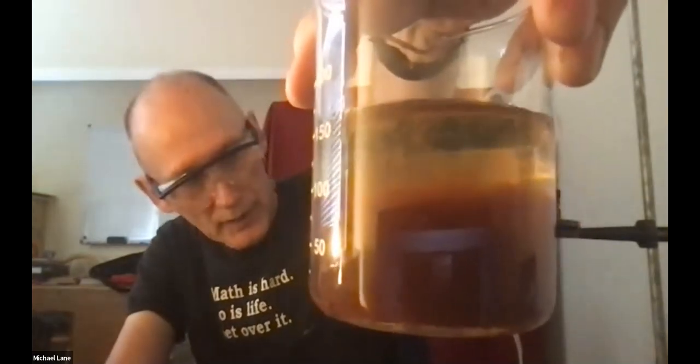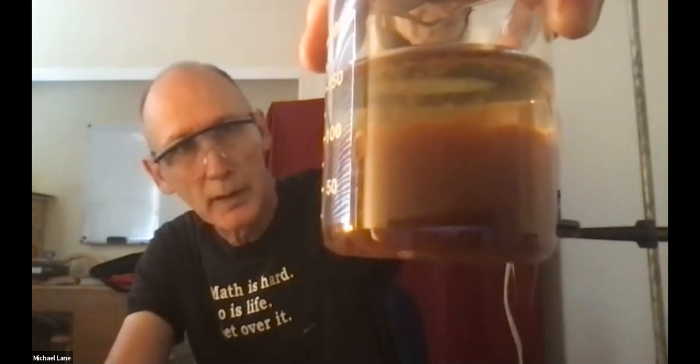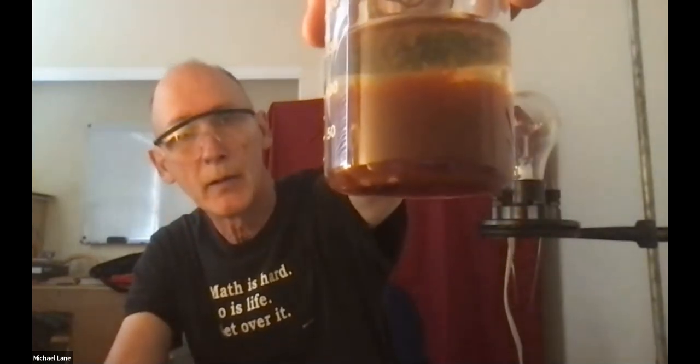So again, I bring this back. You can see it's beginning to settle out a little bit. Now, if I were to leave this sit out for a day or two, it would all very much settle onto the very bottom of the beaker, but unfortunately, we don't have that much time.